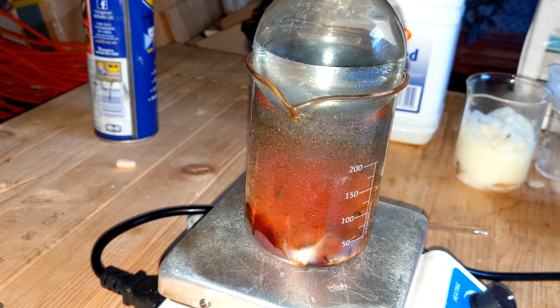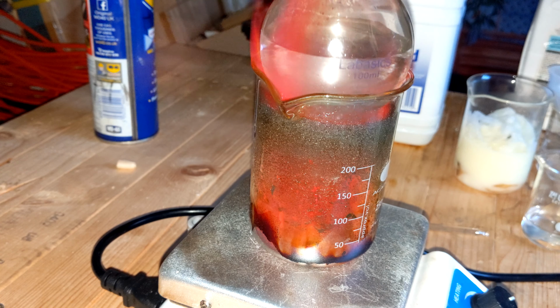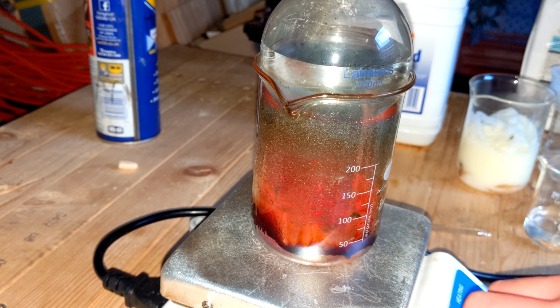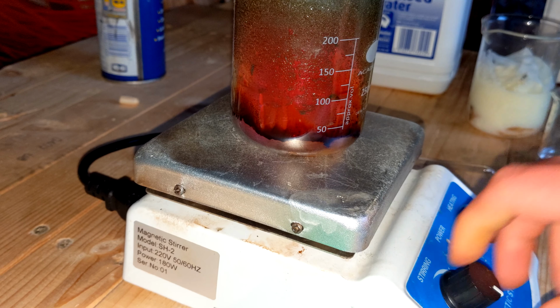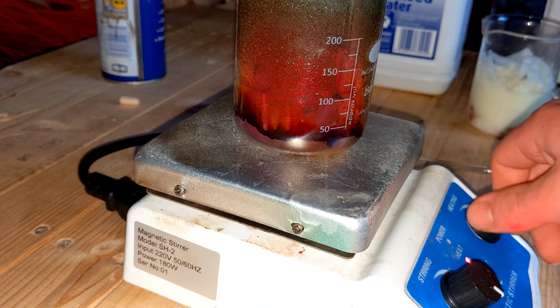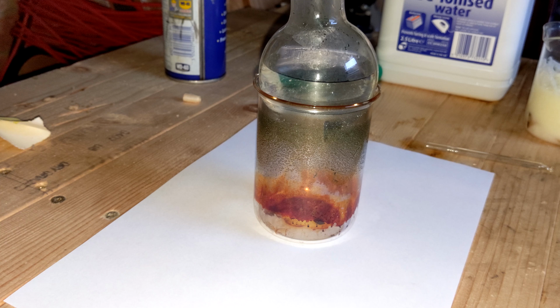It was getting quite dark, so the lighting's not that good. It's getting quite fumey. I don't remember what I was doing here. I was trying to get a better shot of the iodine, I think. Oh yeah, I tried to turn it off, but I accidentally turned on stirring. Took it off the heat. And now we get to collect our iodine.